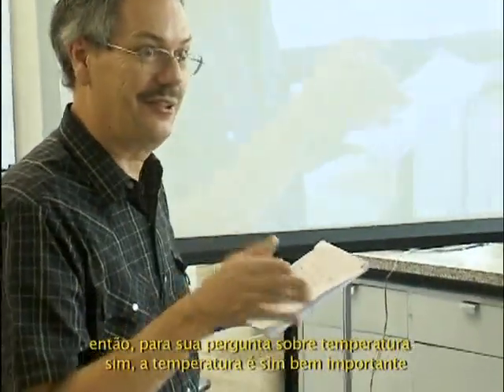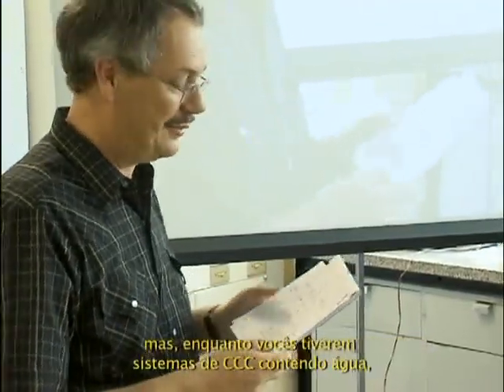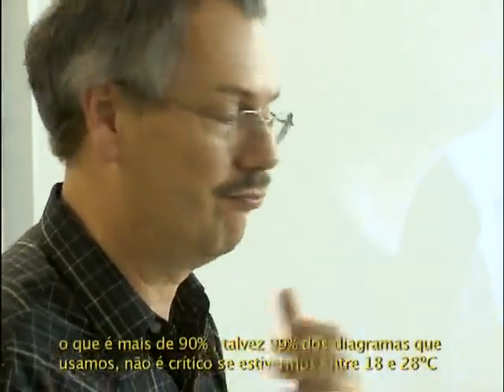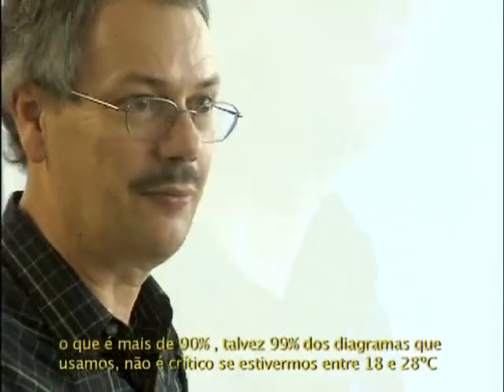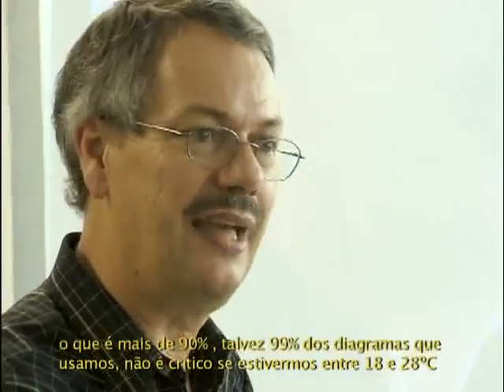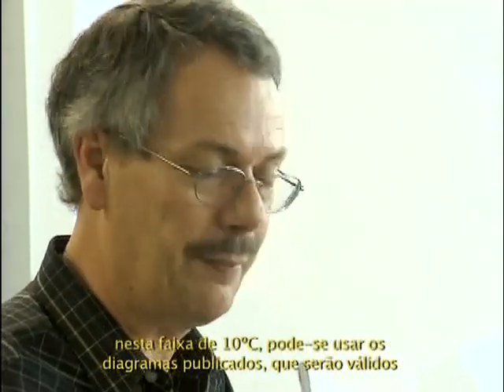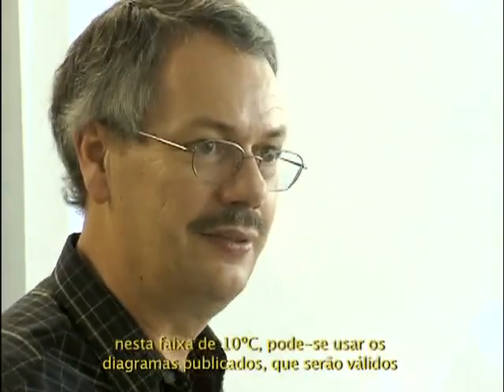So for your question about temperature, yes, temperature is very, very important. But as long as you have water in the system, in CCC, which is 90%, maybe 99%, I don't know, of the phase diagram we use, it's not critical as long as it's between 18 degrees and, say, 28. So on this 10 degrees temperature range, the phase diagram you can find in books is valid. You can work with that.